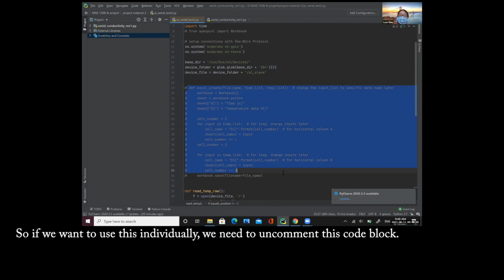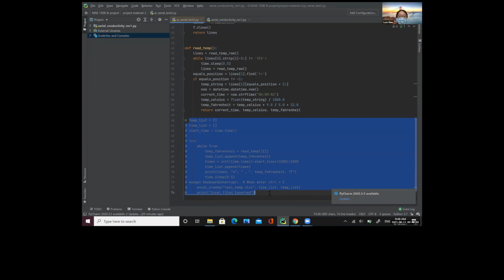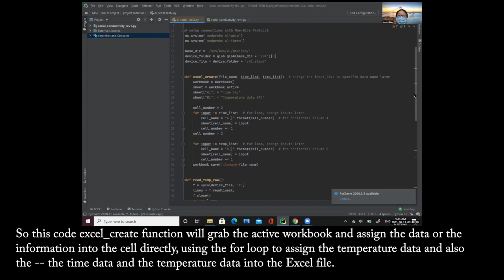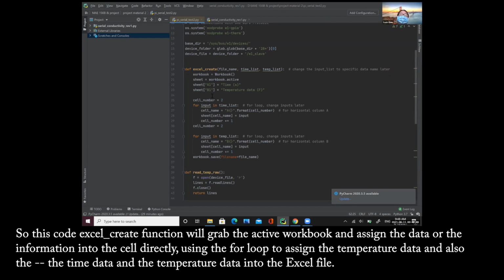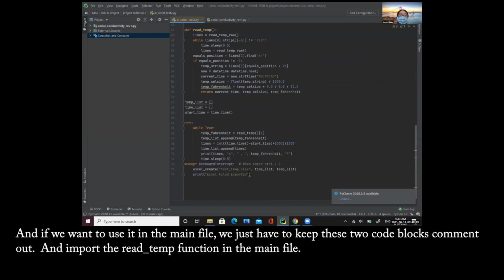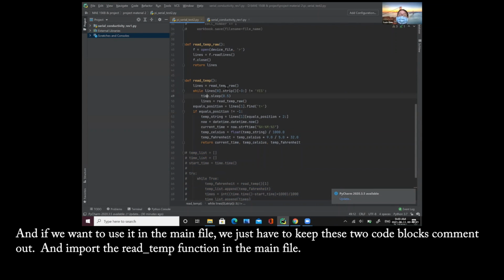So if we want to use this individually, we need to uncomment this code block. We uncomment it by just highlighting the code block and pressing control plus slash. So this Excel create function will grab the active workbook and assign the information into the cells directly, using the for loop to assign the temperature data and also the time data into the Excel file. And if we want to use it in the main file, we just have to keep this code block commented out and import the read temp function in the main file.